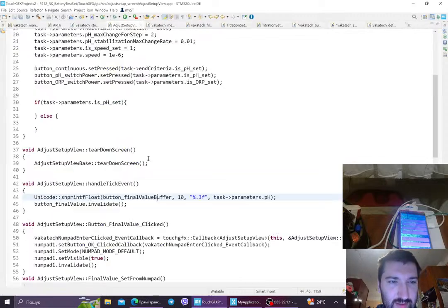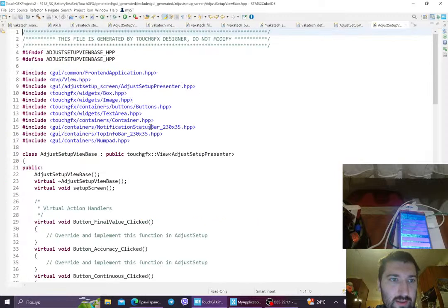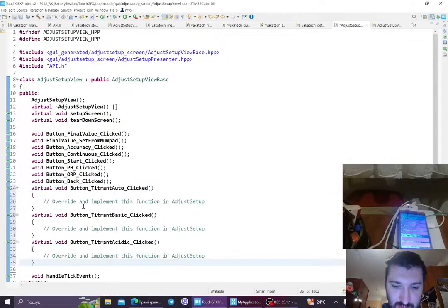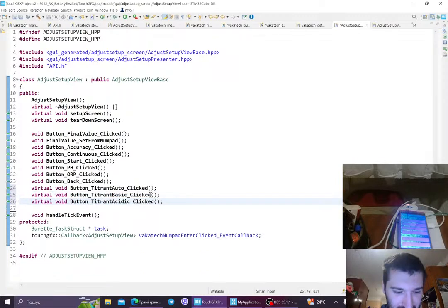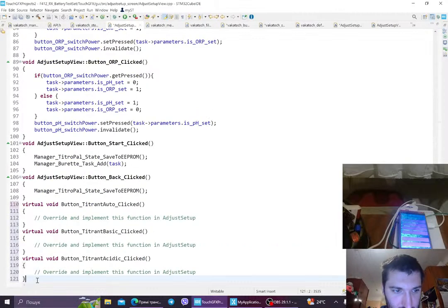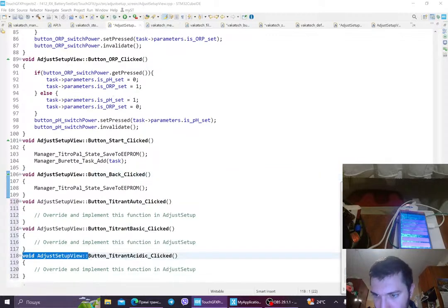This is just setup. These are presenter. This is our CPP file, header file, and here in a generated base file, we're gonna have our functions. Let's go back. Let's replace them here. Now some kind of mundane. Okay, delete. Okay, and let's go back to the C++ file. We'll go here, we will copy this one and change it to this, replace all, close.